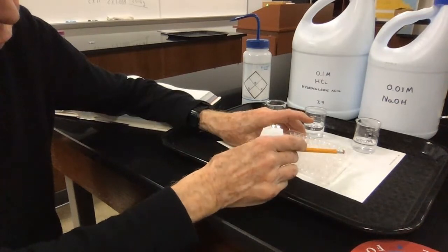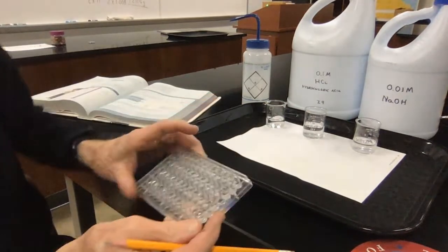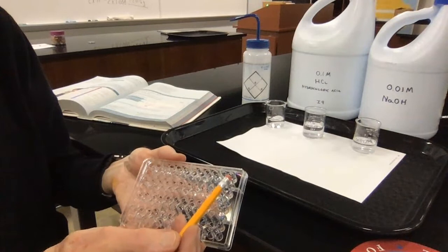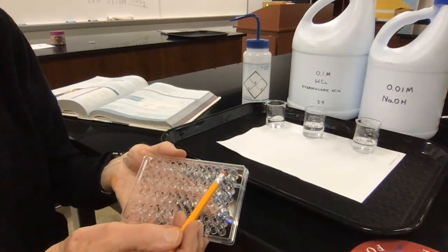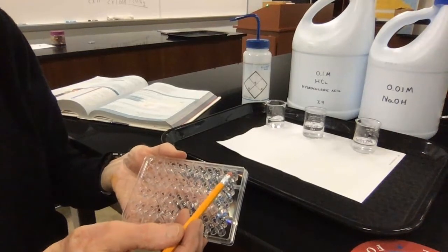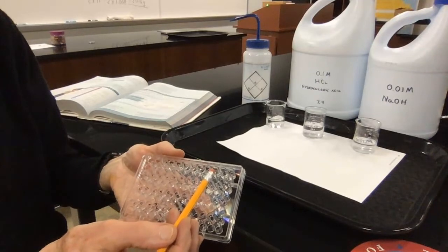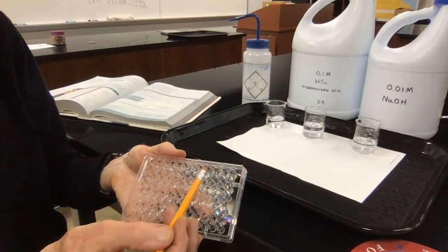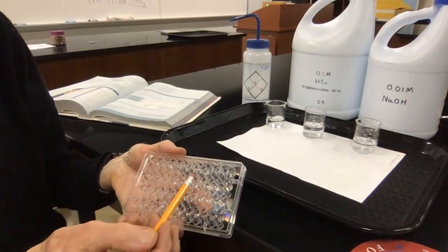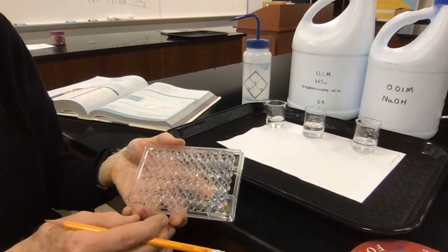I did it in reverse order over here with the sodium hydroxide, so that the sodium hydroxide started off in its 0.01 molar strength. 1 drop out of here, next drop, diluted it by 10, put the rest back. Took a drop out of here, transferred it to well 10, put the rest back, and each sequence here now dilutes it by a power of 10. And then column 7 is no dilution whatsoever of either acid or base.